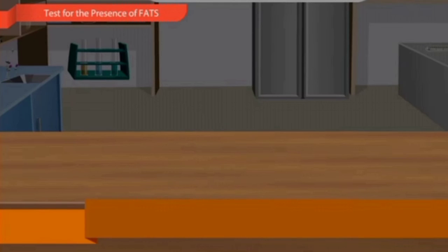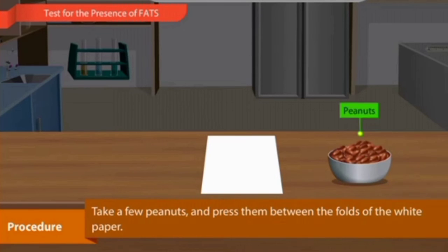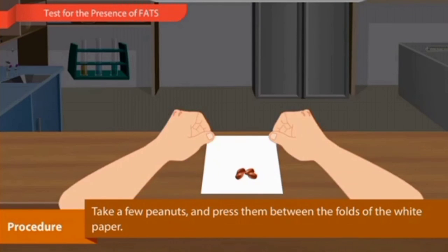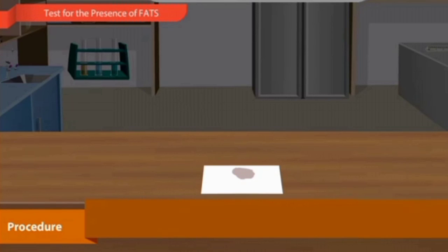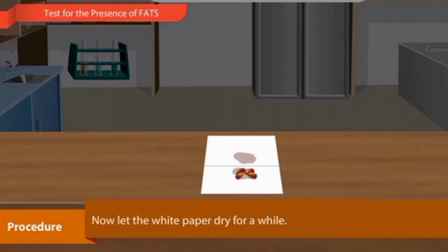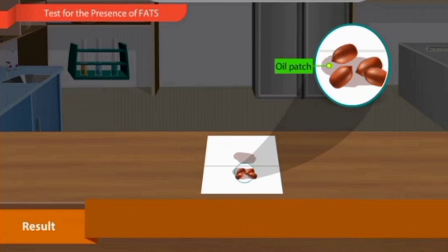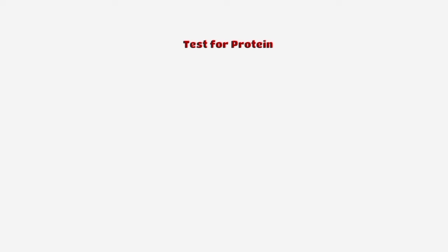The next test is for the presence of fats. The procedure is to take a white paper, take a few peanuts and press them between the folds of the white paper. Here I'm showing how you can press them. Press them gently with the white paper, and then observe. Now let the white paper dry for a while. You can observe that the white paper becomes translucent and an oily patch appears on it. This oily patch confirms that fat from the peanuts is present.